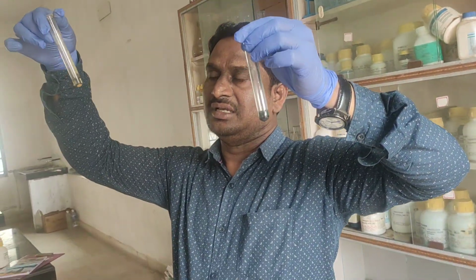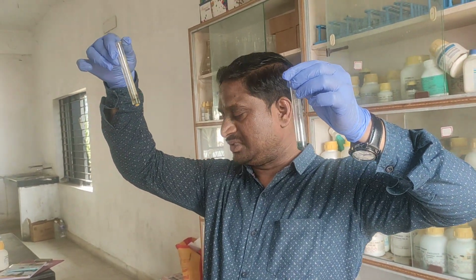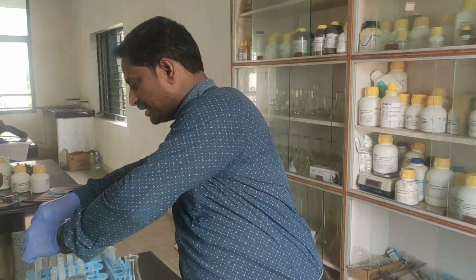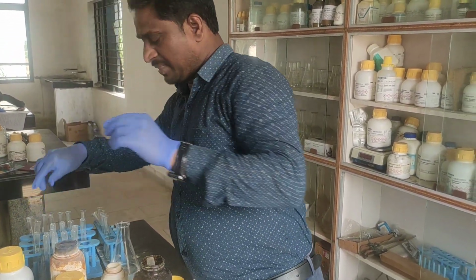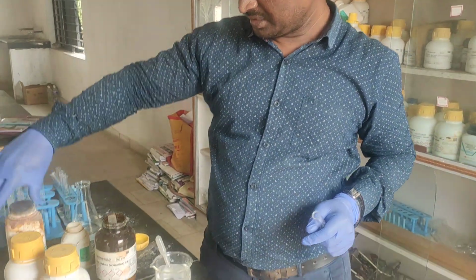So what is the ion test we have done now? Fe+2. This is the cation test. Now let me go for another one, that is FeCl3.